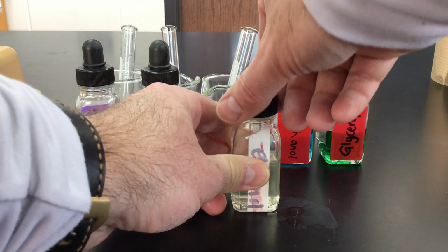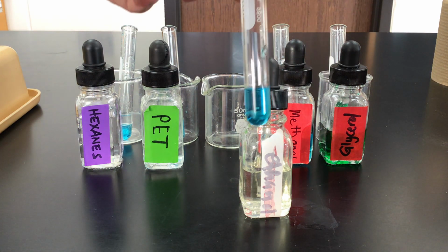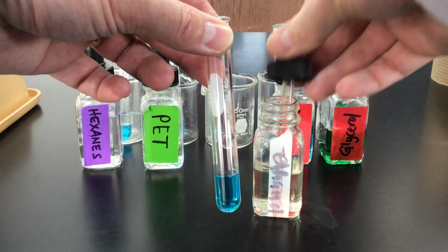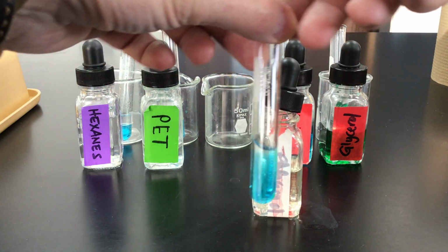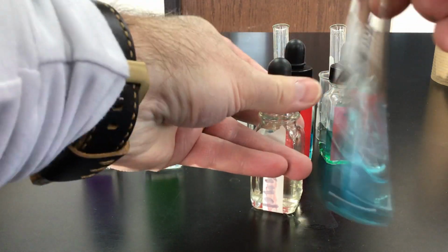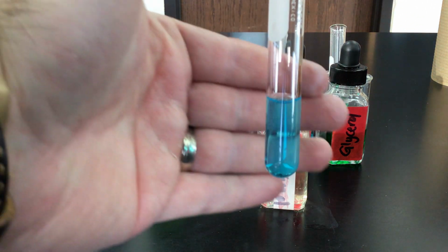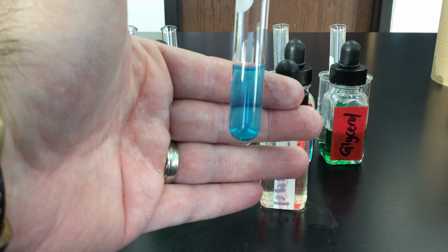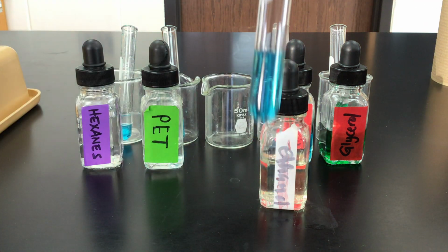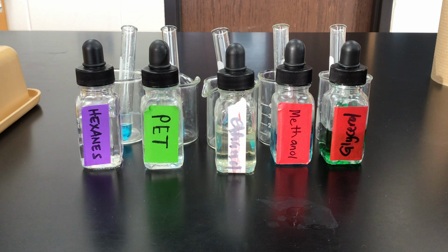Next we're going to do ethanol, otherwise known as ethyl alcohol. This is the alcohol that's in booze. All right, so mix that in there and give it a little shake. All right, and as I look at this here, I am not seeing any layers. So I would say that ethanol and water are soluble, and that makes sense if you consider the alcohol that's in booze. That's not 100% ethanol or ethyl alcohol. It is mixed with water for sure.